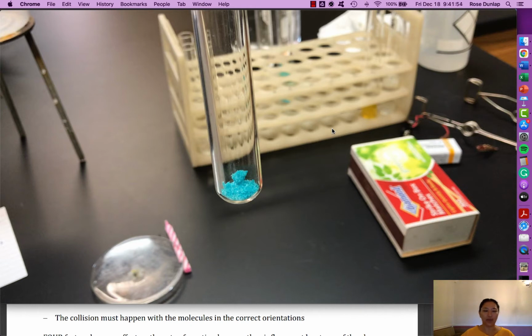Follow along with your procedure, and you will take excellent observations, meaning you should observe all the things that you can see with your eyeballs, and all those things should be jotted down in the appropriate section for each experiment. And then we will take all these notes together, and you will be able to answer a whole bunch of analysis questions and take stock of all the amazing chemistry things you know.